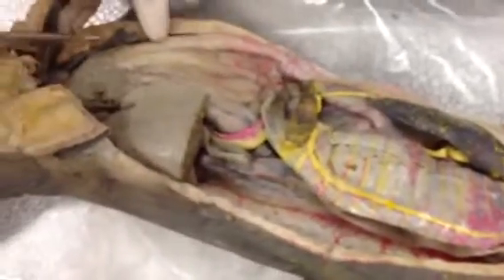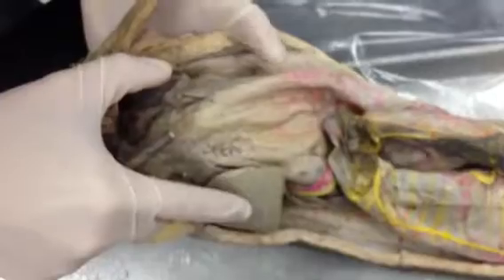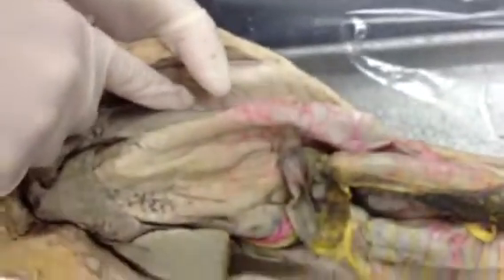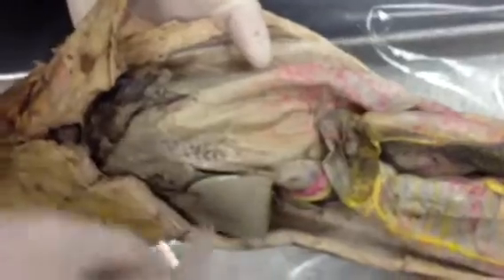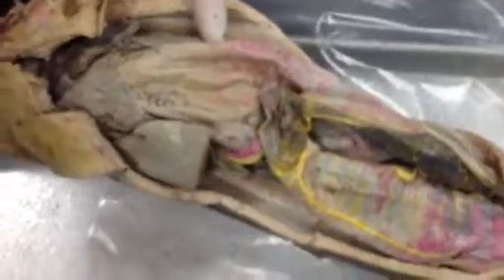For all of the visceral organs, the biggest one you'll see is the liver. I cut my lobes off, but you'll just see the lobes here. You have the right lobe, the median lobe, and the left lobe. On the exam you'll need to refer to them by their specific name — not just say 'liver' — or points will be deducted.